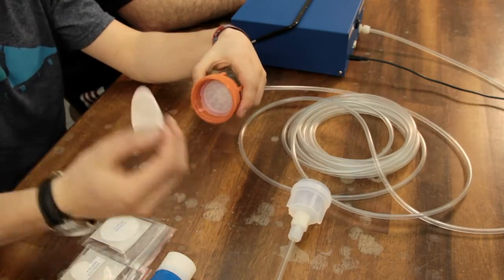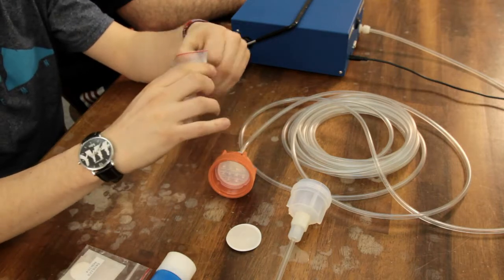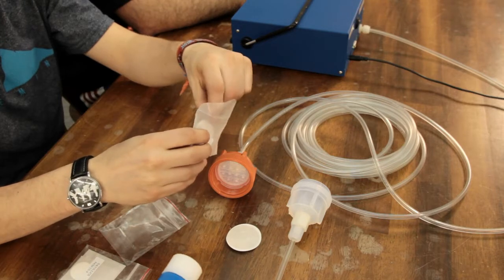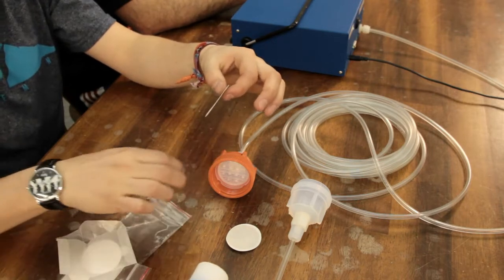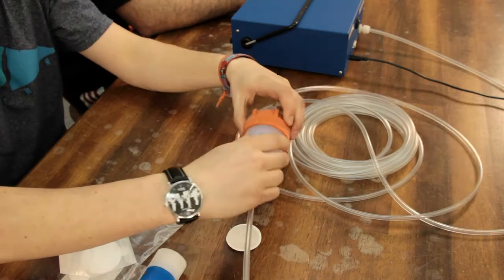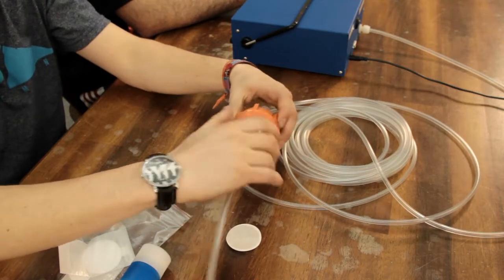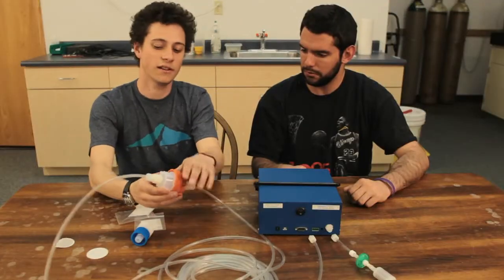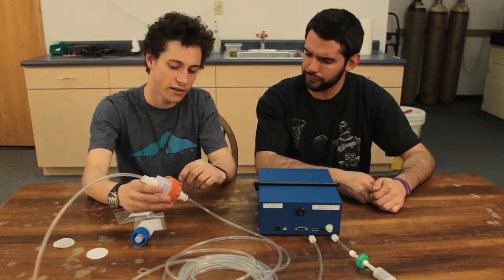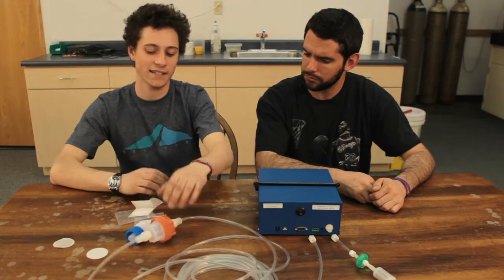Next, you can take the old one out, reach into your bag, and pull out a fresh one. Then, just place it back in, twist it back on, and you're set. Awesome. Now you can follow the arrow for the direction of airflow towards your ozone monitor. After that, give your tubing a little tug, and that's all.